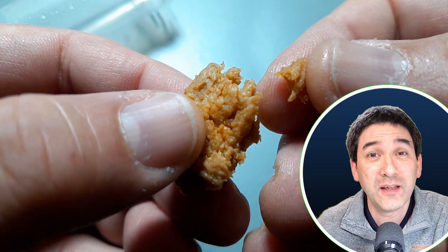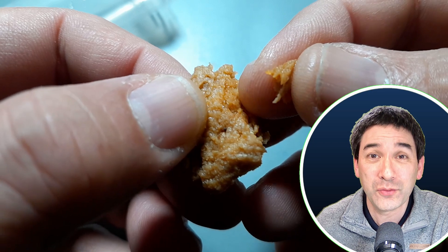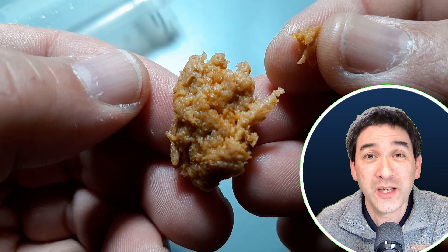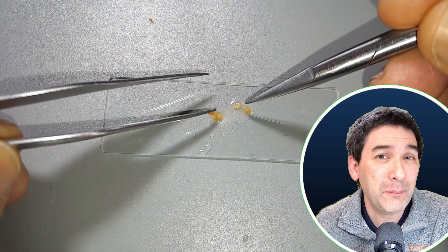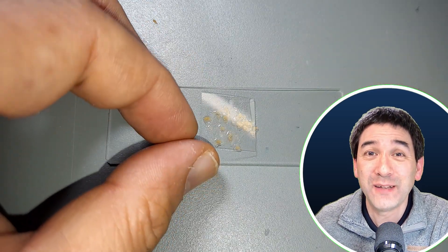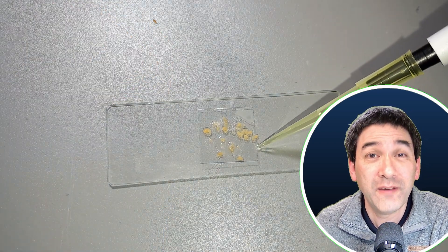What I've done is I've immediately made a specimen slide to observe under the microscope. For storing it for a longer period of time I also stored it in alcohol, which has of course withdrawn some water. A small sample I placed on a microscope slide. I pried it apart using a few tools, added a cover glass on top to make sure everything is nice and flat, and then I simply put it under the microscope to observe what I find.